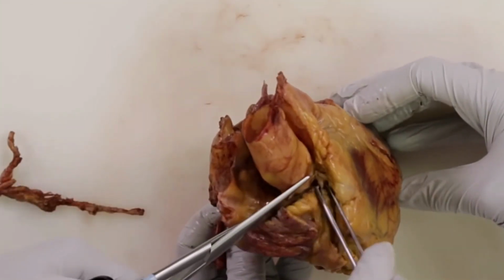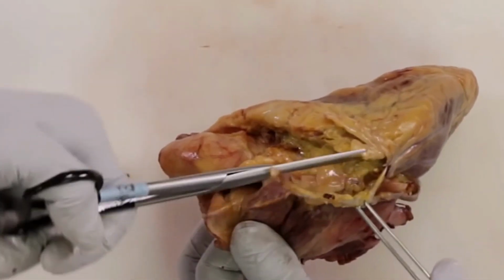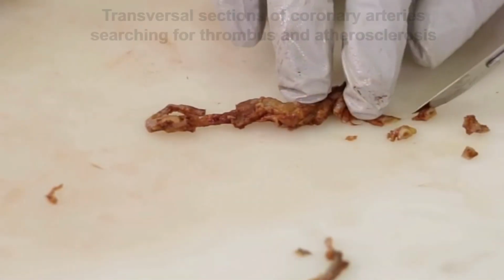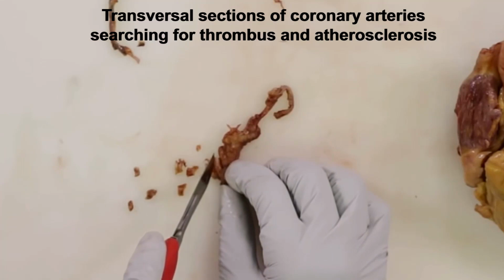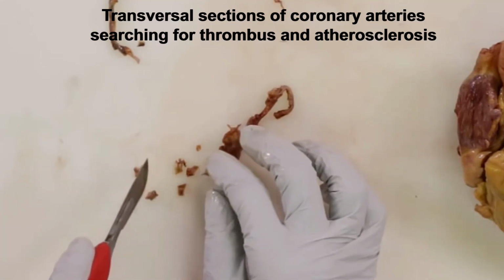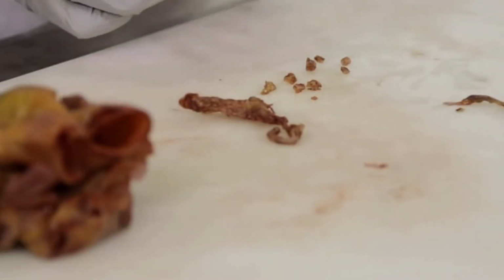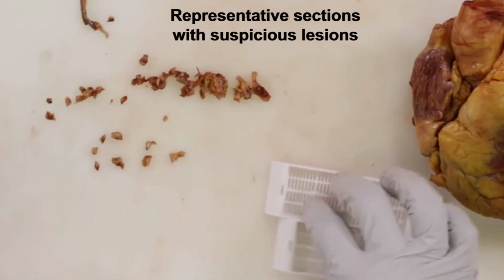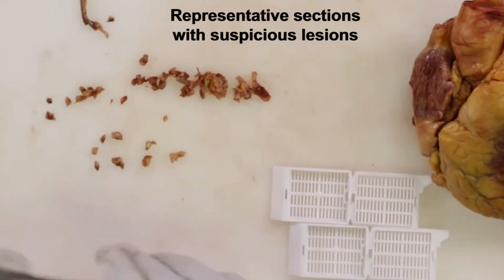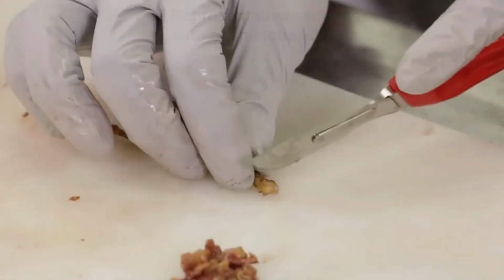And again, trying to get the area where it's coming out of the aorta, and then some of the more peripheral aspects. In this particular case, they haven't fixed the vessel, but they are proceeding to make these sections that I mentioned before with 3 millimeter intervals, and then representative sections, especially the areas that are more concerning for obstruction, are submitted in the corresponding cassettes.